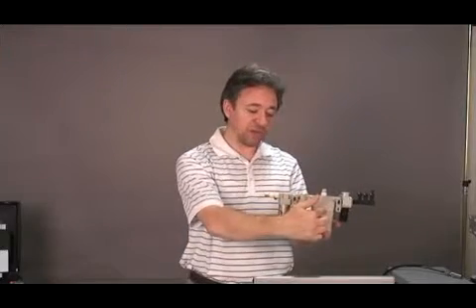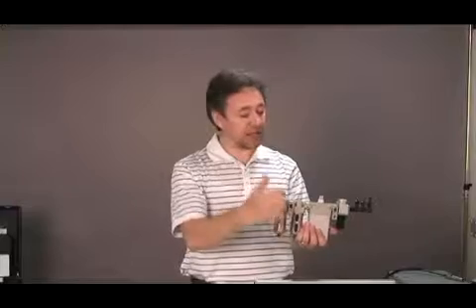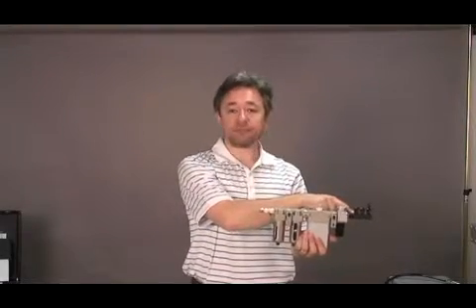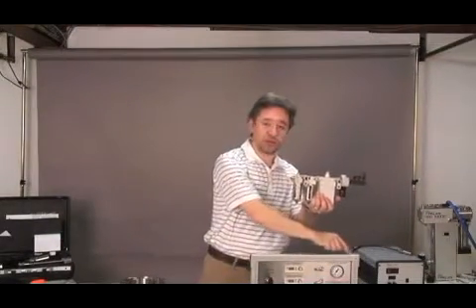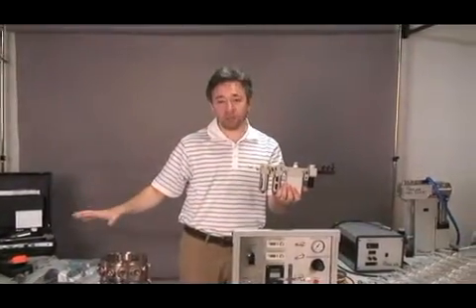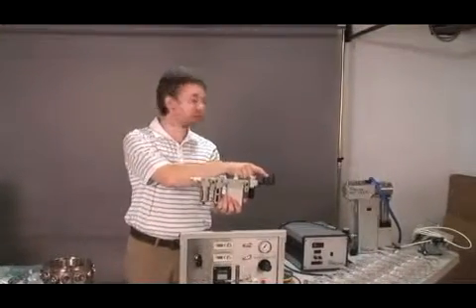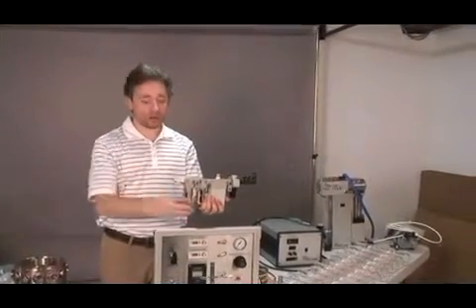The air is treated to remove any particles, droplets of oil, as well as humidity, and then is distributed by this manifold. One line goes into the control panel that supplies all the dilution breathing air for the system, and the other one is going to be used exclusively to run the rotating brush generator when you're generating powders.